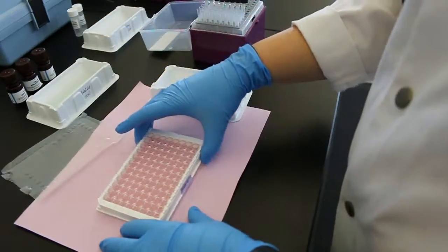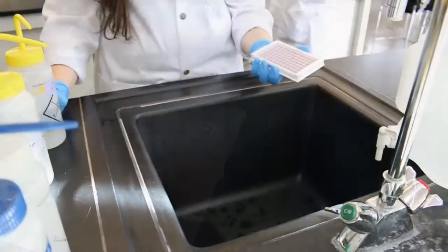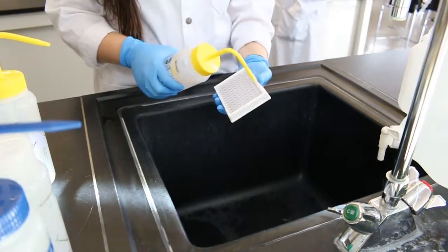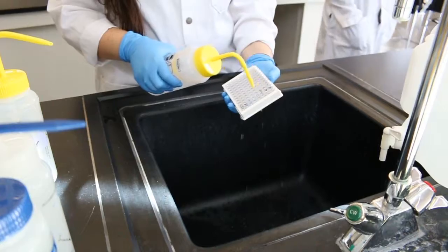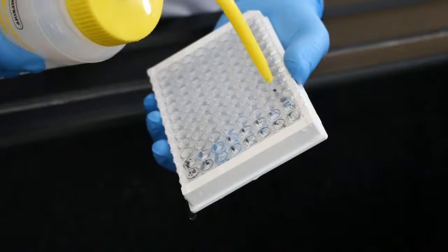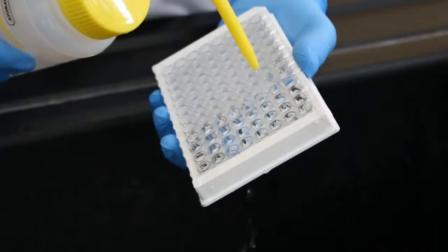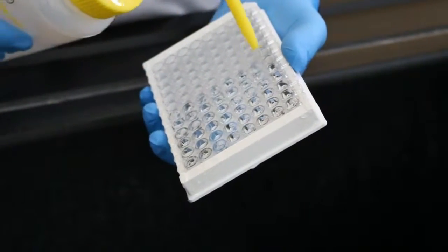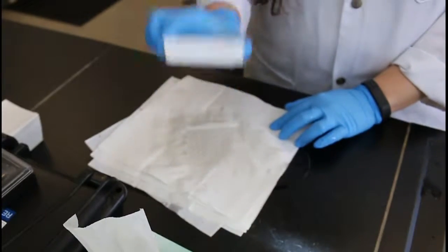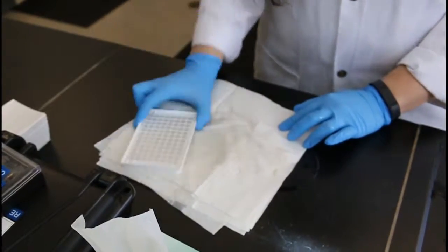After the incubation period, the covering is removed and contents of the wells are vigorously shaken into a sink. The wells are then washed three times with a multi-channel pipette or wash bottle using the wash buffer solution provided in the kit. The contents of the wells are dumped into a sink between each wash. After the wash, the plate is pat dry on an absorbent surface to ensure all of the wash buffer solution is removed.